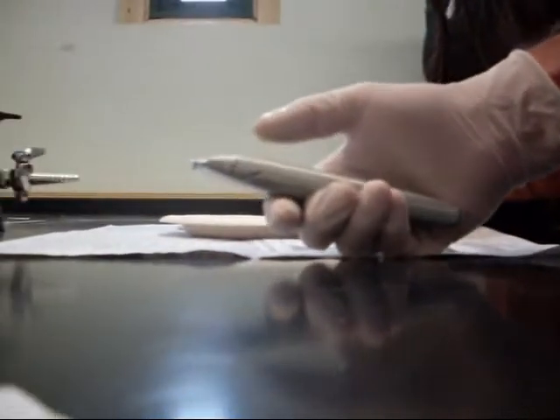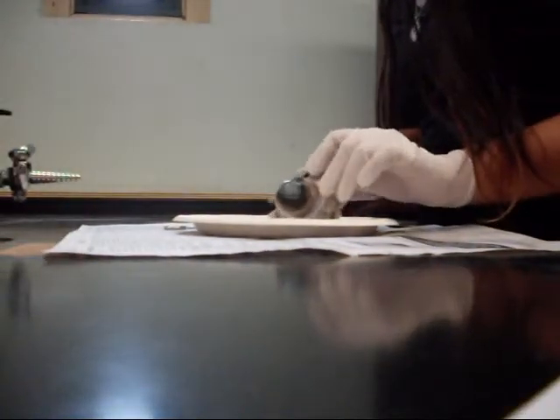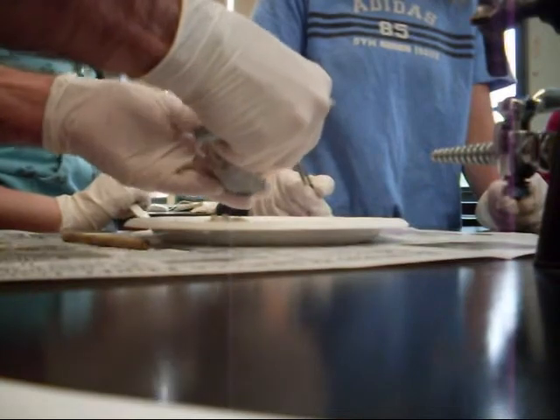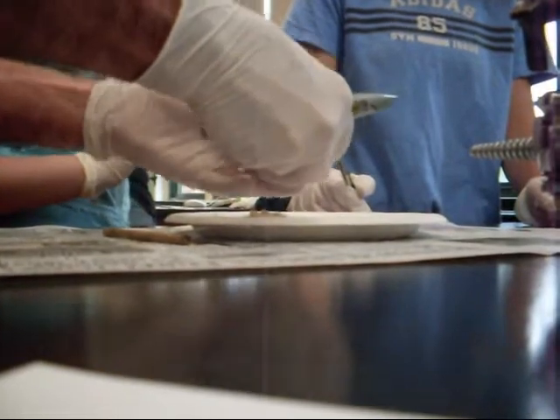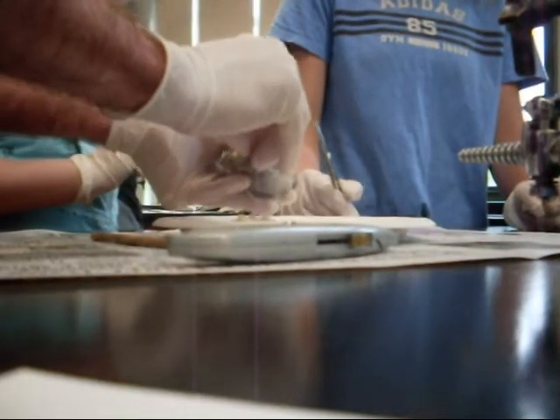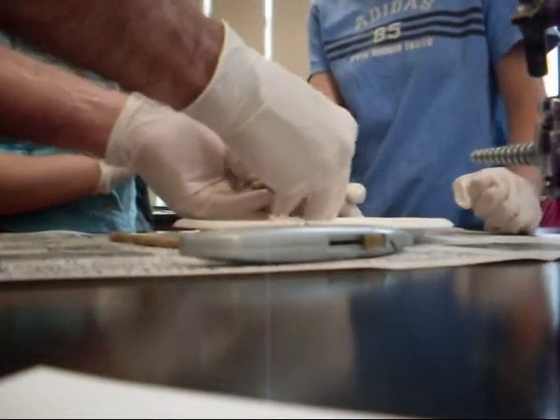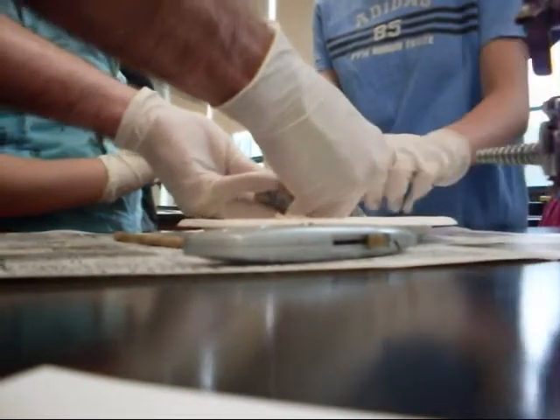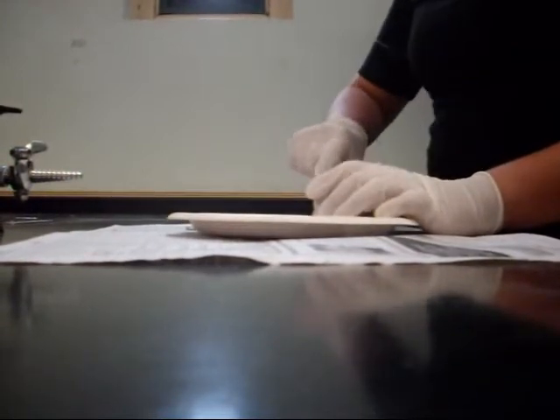How's the trimming going over here? Not easy. I know. I don't want to cut that off. Nope. I might be able to crack it. The only reason that it's good to see — wow, you've got a lot of fat here. Do you know what that is right there? The optic nerve. Yup. That's the nerve that's connected to the brain. Just feel the difference in it — it's like a very, very hard cord. Feel the difference between that and the fat and everything. I think we should get a couple of those.